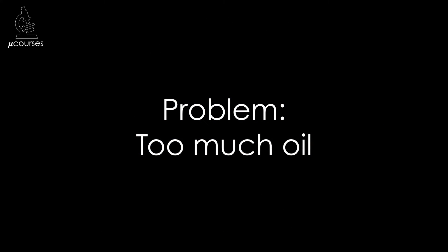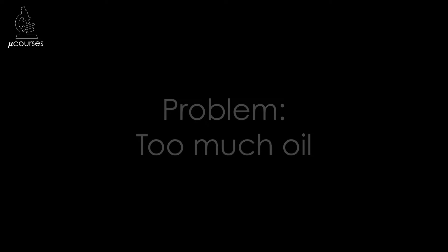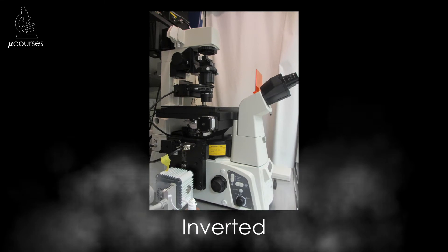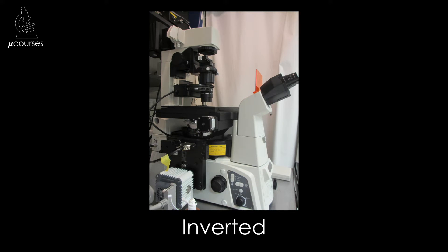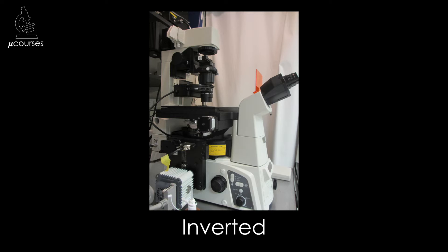Perhaps an even worse problem with immersion oil is when too much immersion oil is used, because this can lead to problems with the objective lens that need to be repaired. Using too much immersion oil is more of an issue for inverted microscopes versus upright, and it'll become clear why as I walk through it.